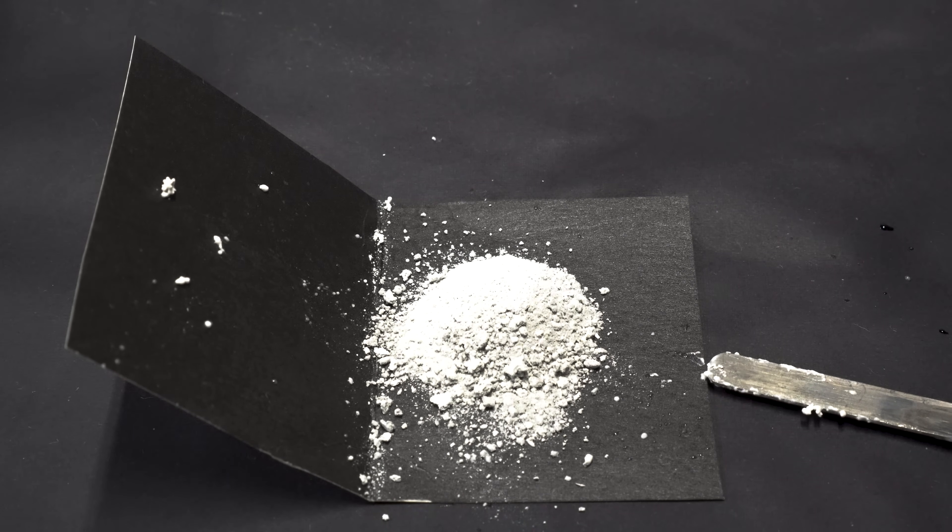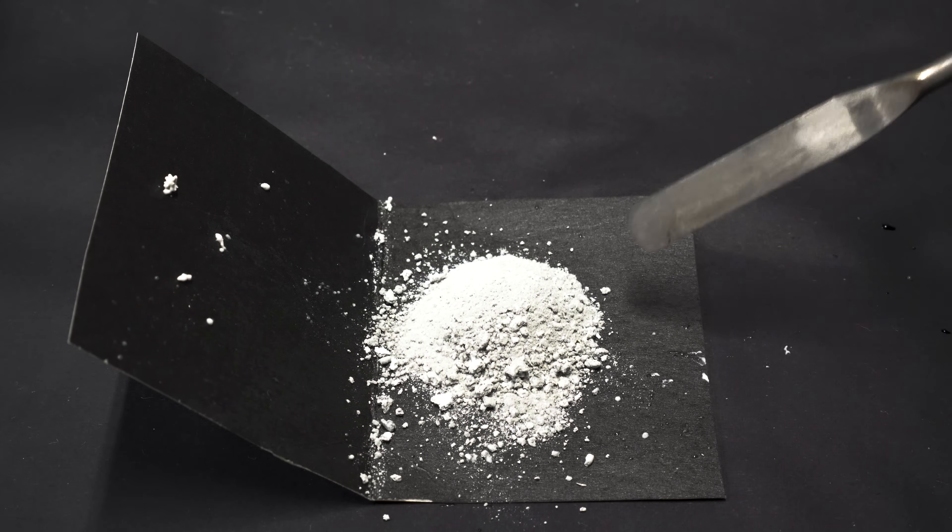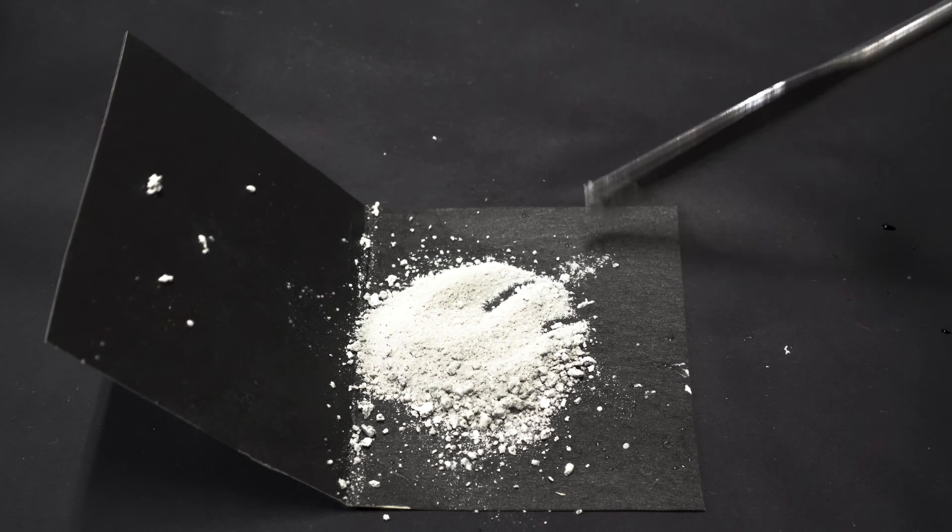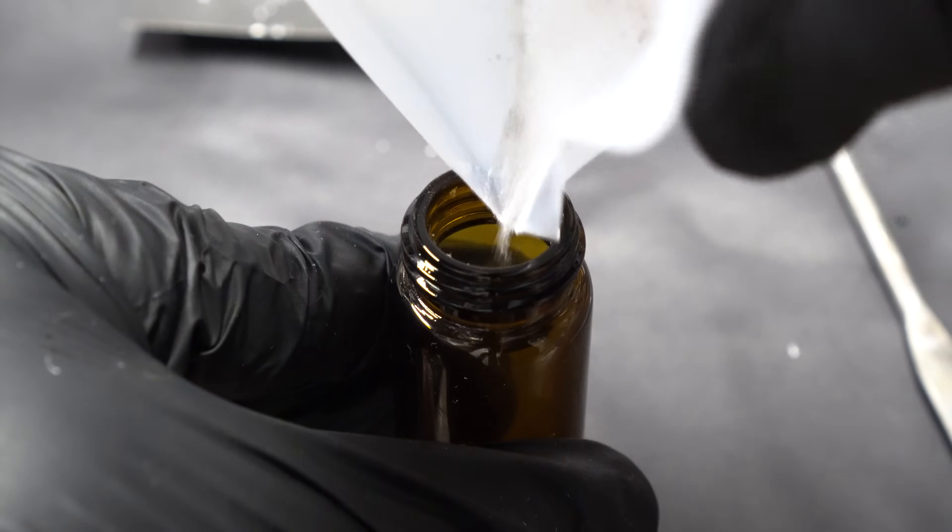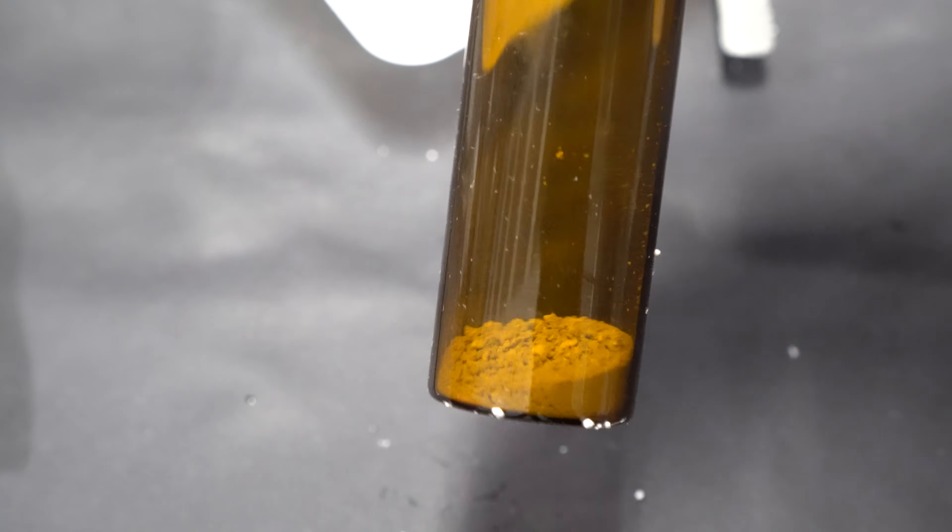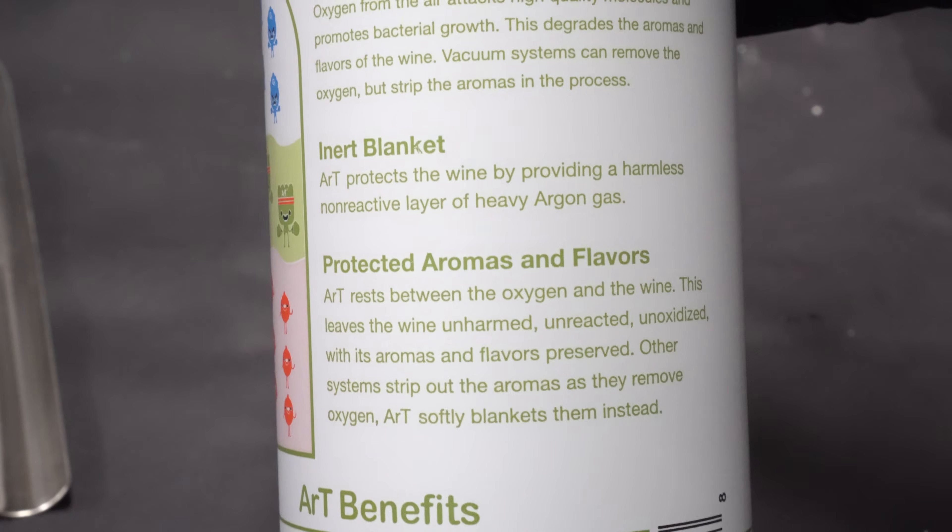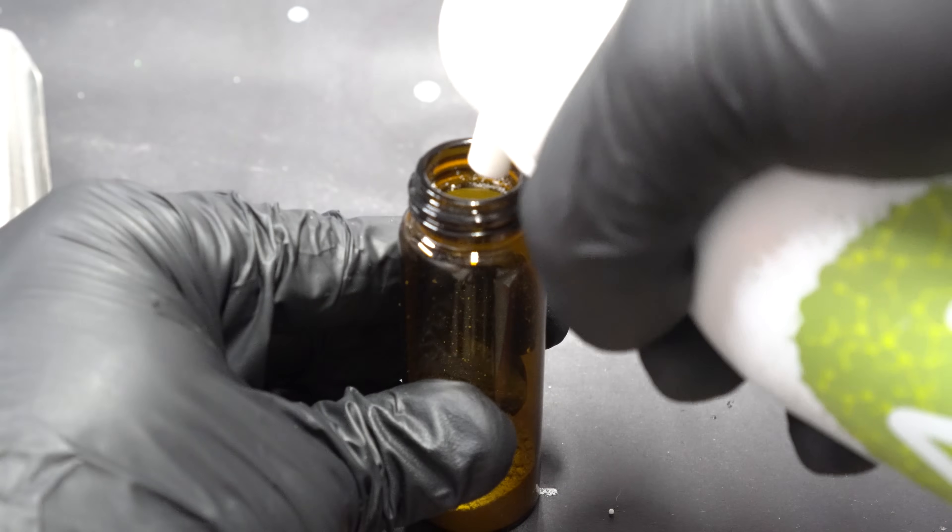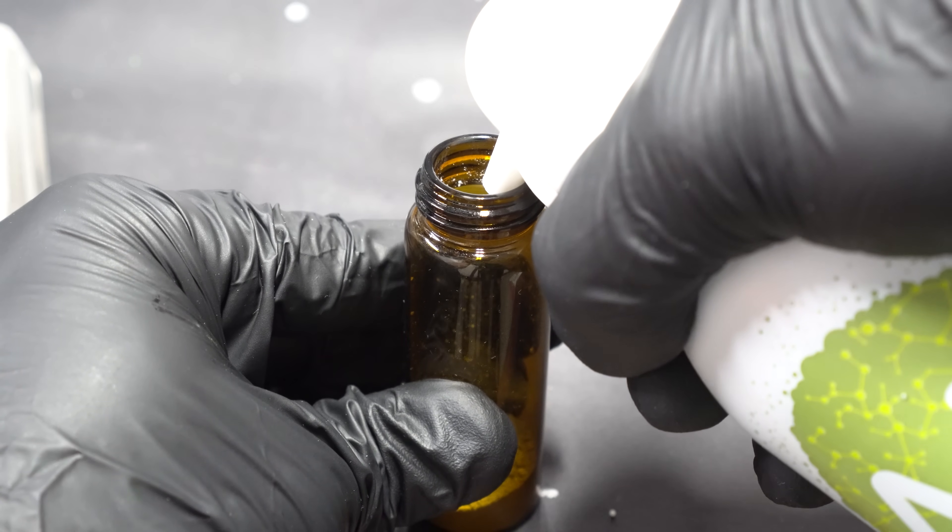Unfortunately, I never weighed the sodium amide, and I overexposed the shot. I was very careful not to scrape the sodium metal out, and this should be pretty pure. We want to be careful not to breathe any of the dust in, and I immediately put it into a container. I stored this in an amber glass vial, but it really doesn't need to be amber. It really just needs to be protected from the outside air. A good idea would be to store this under an inert gas. I decided to go with argon, as that's what I had handy. They actually sell argon in these wine preservers that you can buy on Amazon. The argon being heavier than oxygen will displace the air, and a layer of argon will be over our sodium amide.